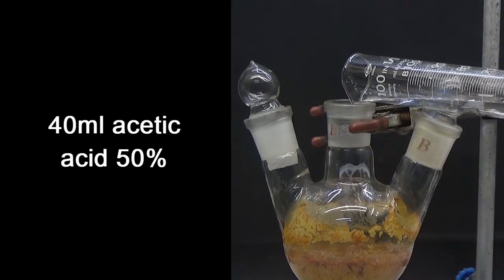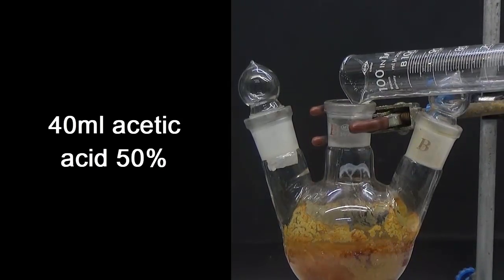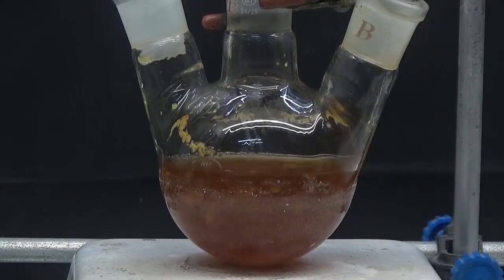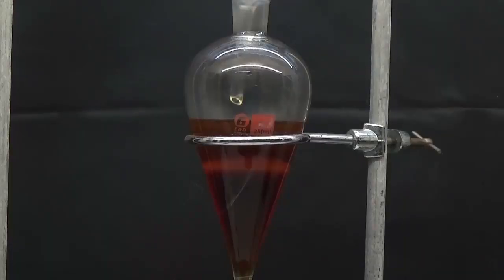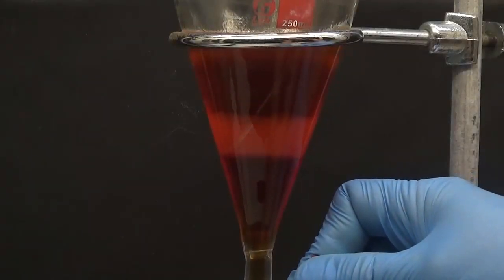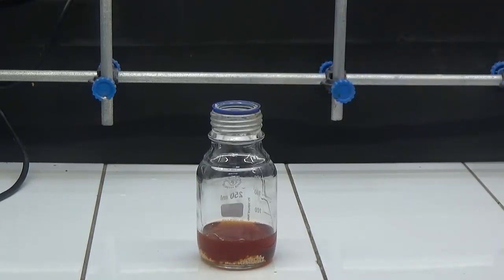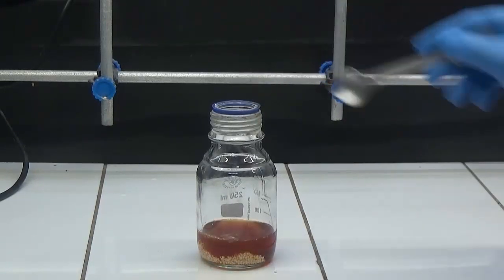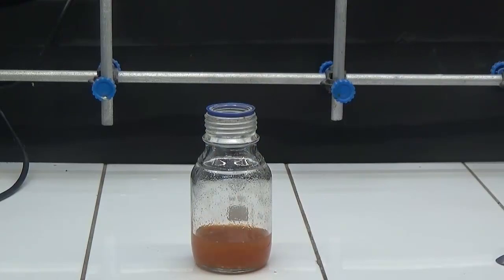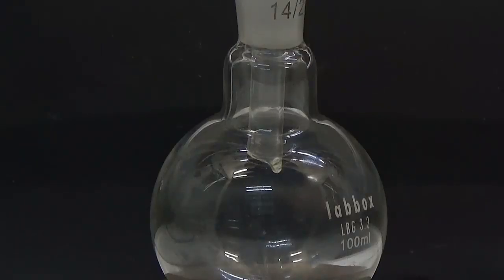Add 40 ml of 50% acetic acid; a floating layer divides and the solid dissolves. The organic layer is separated in a separatory funnel, then dried on calcium chloride and filtered. It was filtered twice, as in the first filtration a small amount of calcium chloride was observed.